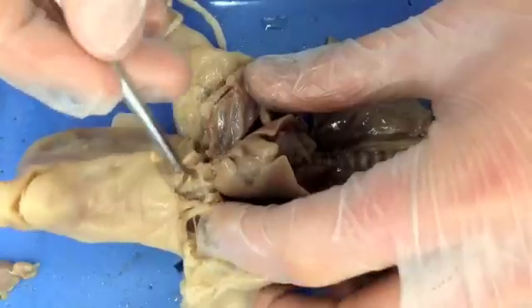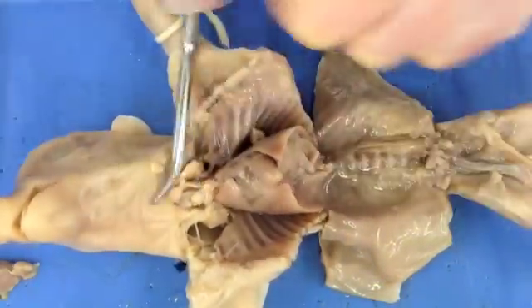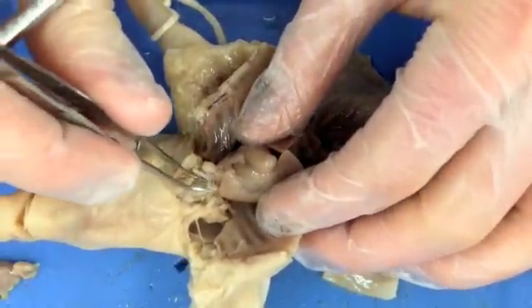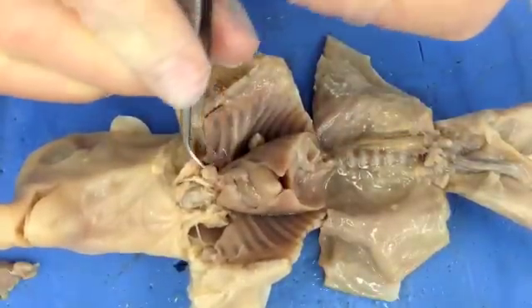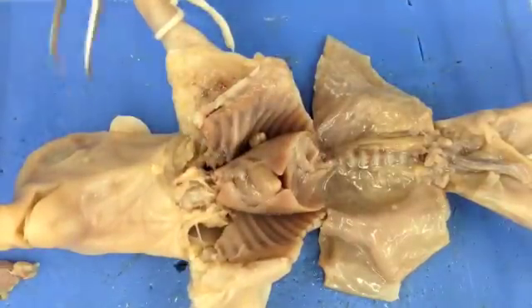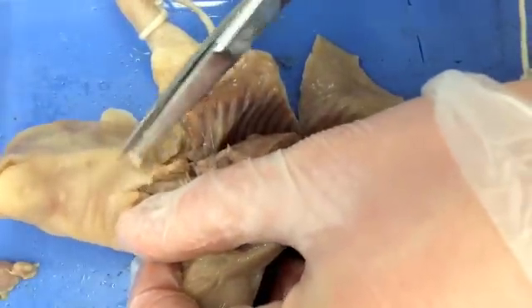You're starting to see the trachea underneath here — it's right there. What I'm going to do is try to take some of this tissue away. It's actually a decent time to pull in some tweezers. I'm just trying to remove some of this tissue here. Now if we cut up a little bit further, we start to expose more.